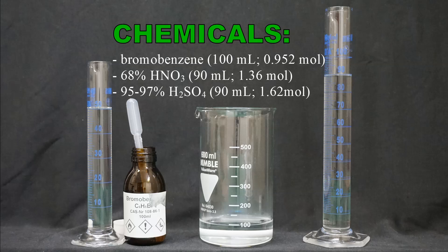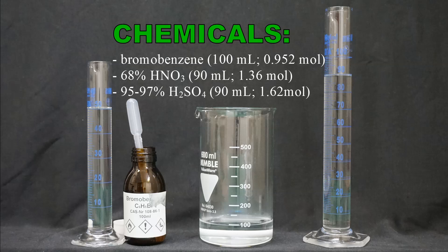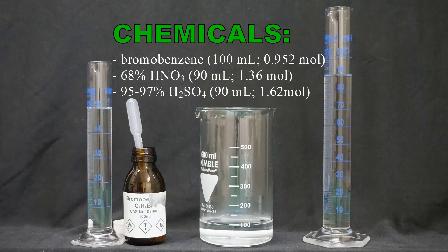In the image you can see the chemicals I used for this reaction. On the left, 100 ml of bromobenzene — you can see half of it in the 50 ml graduated cylinder and the other half is still in the flask it came in. In the middle, a 600 ml beaker, there is 90 ml of azeotropic 68% nitric acid. And in the 100 ml graduated cylinder on the right, there is 90 ml of concentrated sulfuric acid.